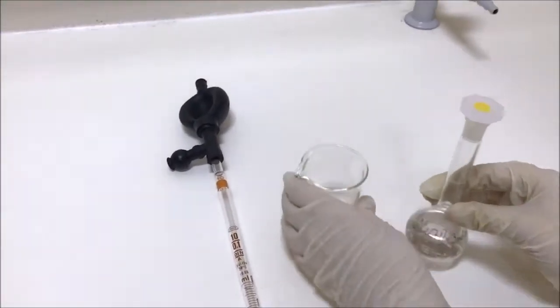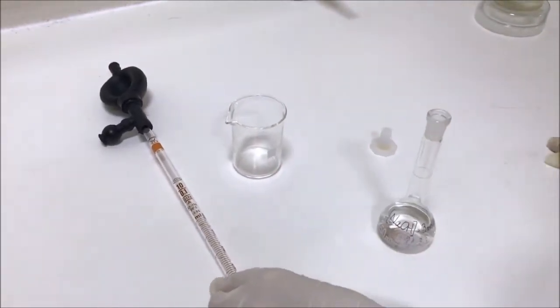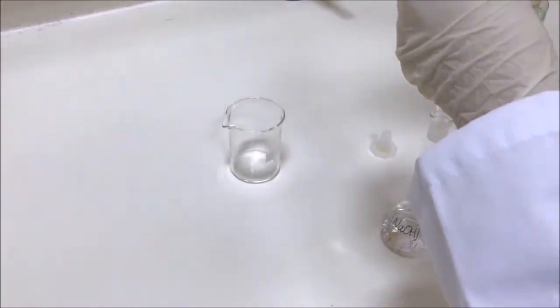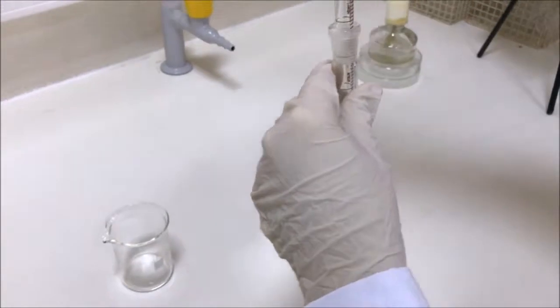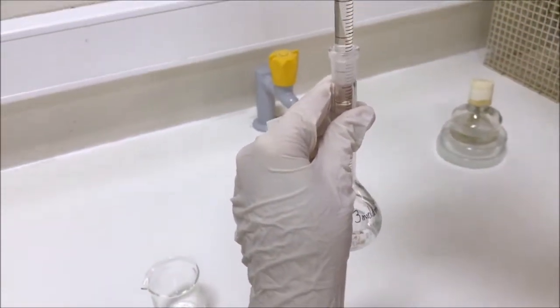Place 15 ml of sodium hydroxide solution into a 100 ml beaker using a pipette and add 10 ml of coconut oil. You can also add dye.